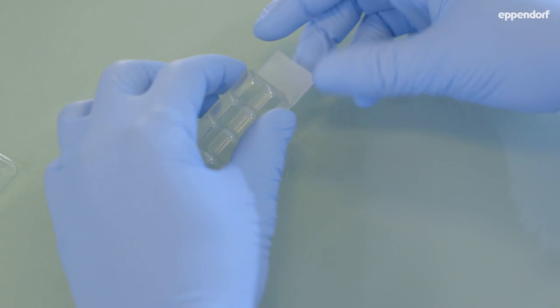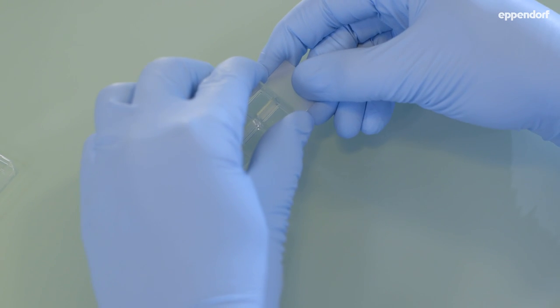After removing the chamber, the slides can be mounted with a coverslip for microscopic analysis.